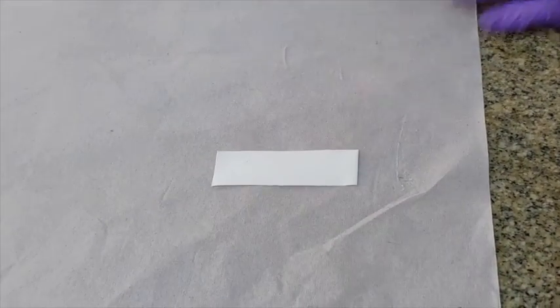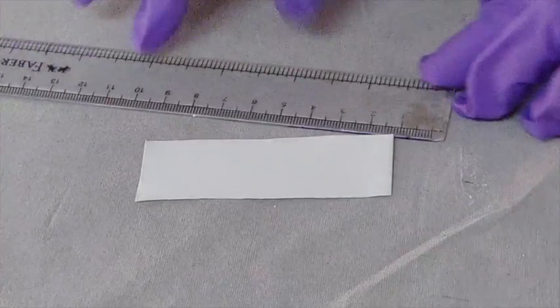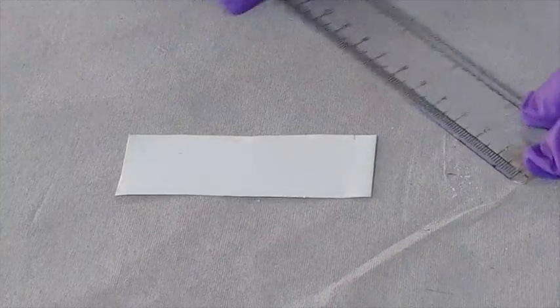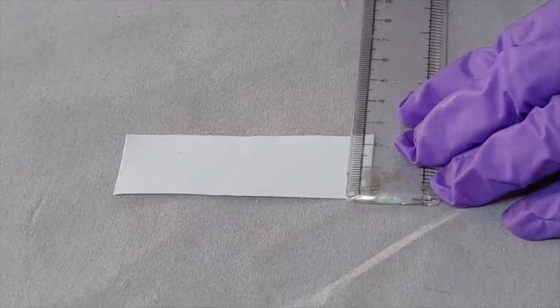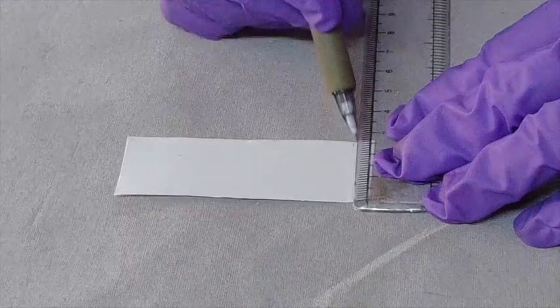To begin with the procedure for TLC, the TLC plate was taken using tissue paper and forceps, because the hand sweat containing amino acids will contaminate the TLC plate. The TLC plate of desired length was cut using the scissors, and leaving 0.5 centimeter from the bottom, draw a thin line using the pencil and the ruler.